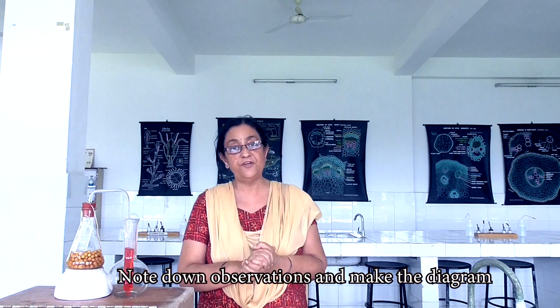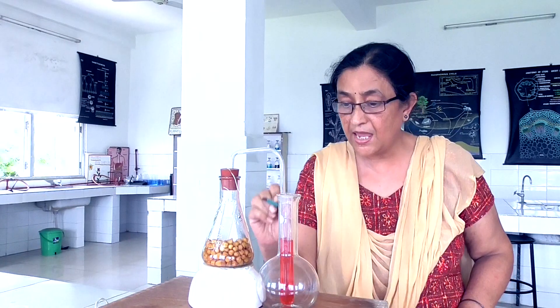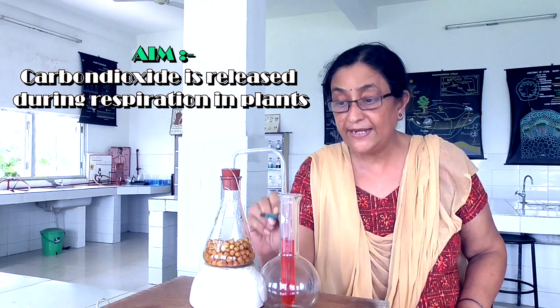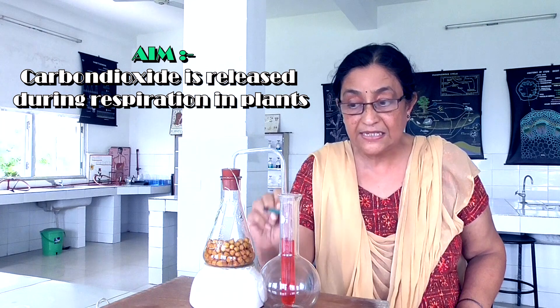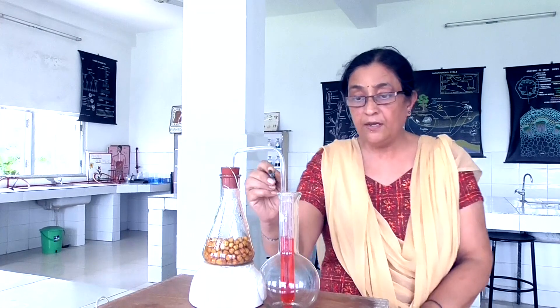I will tell you one by one — you just observe everything properly, then note down your observations, and then you can make the diagram. Children, the aim of our experiment is to prove that carbon dioxide is released during respiration in plants. In this case, we are taking germinating seeds as plants.